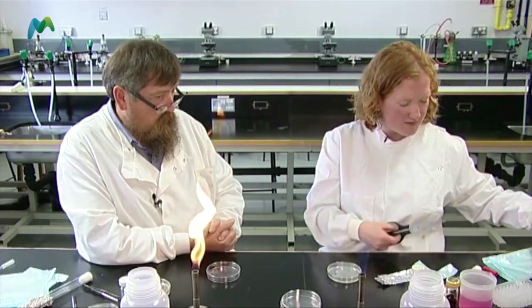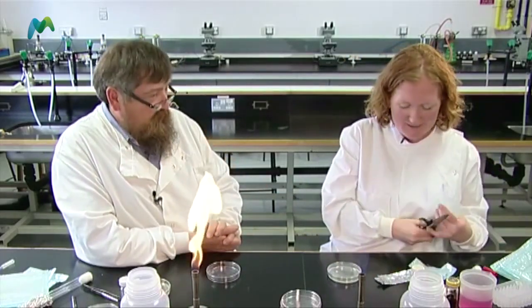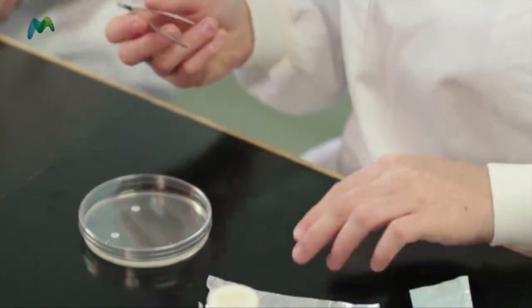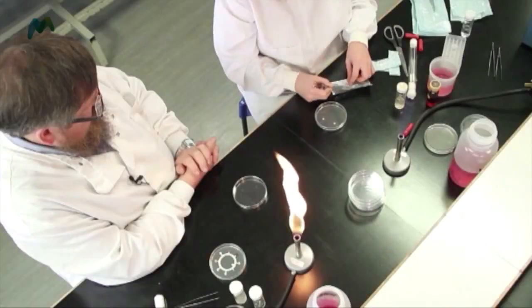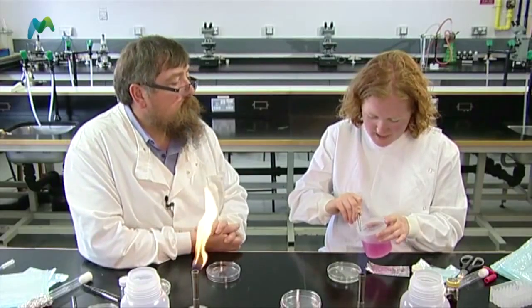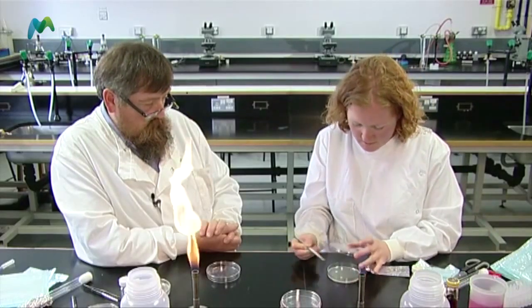We've already talked about using Virkon in the lab as a disinfectant. How effective is it against the E. coli we're using today? We tell the pupils, so we want to test it and make sure. I've got the normal standard Virkon at working concentration in this beaker. Dipping the disc in and then placing it onto my plate.